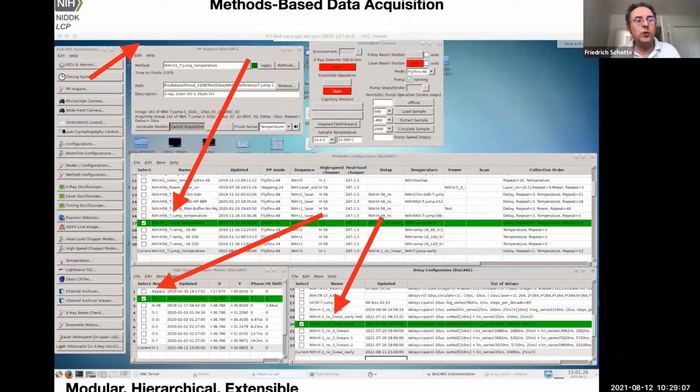So this is an overview of how the software looks on the control station of the ID14B4 Beamline. We have a start menu which contains all the applications, and you can launch them by clicking these buttons. The main one we are using is called Player Piano Acquire, or PP Acquire for short, that controls all aspects of the data collection.